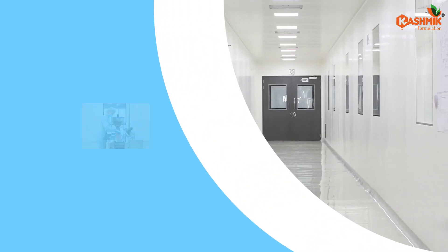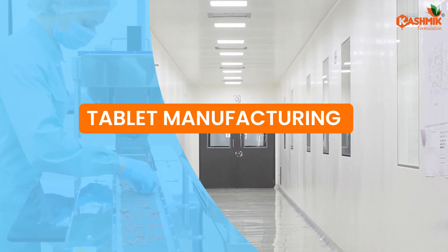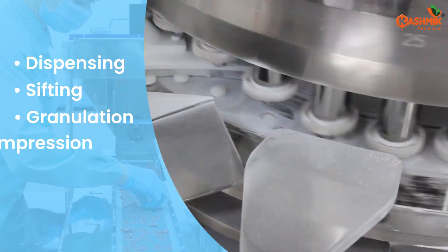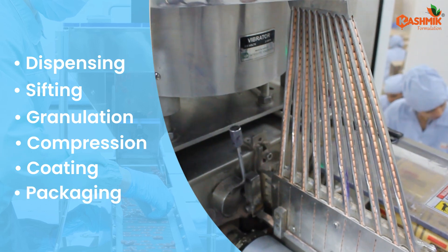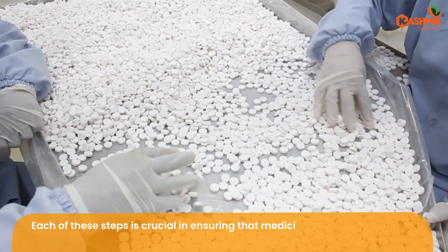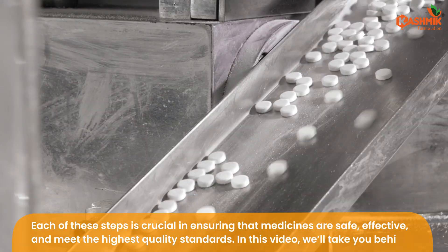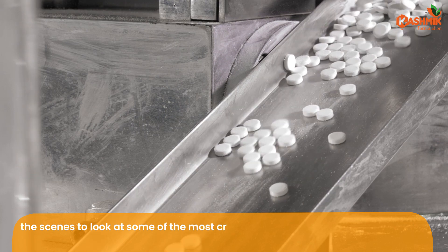Today, we'll explore the process of tablet manufacturing, which involves several essential steps: dispensing, sifting, granulation, compression, coating, and packaging. Each of these steps is crucial in ensuring that medicines are safe, effective, and meet the highest quality standards. In this video, we'll take you behind the scenes to look at some of the most critical stages.